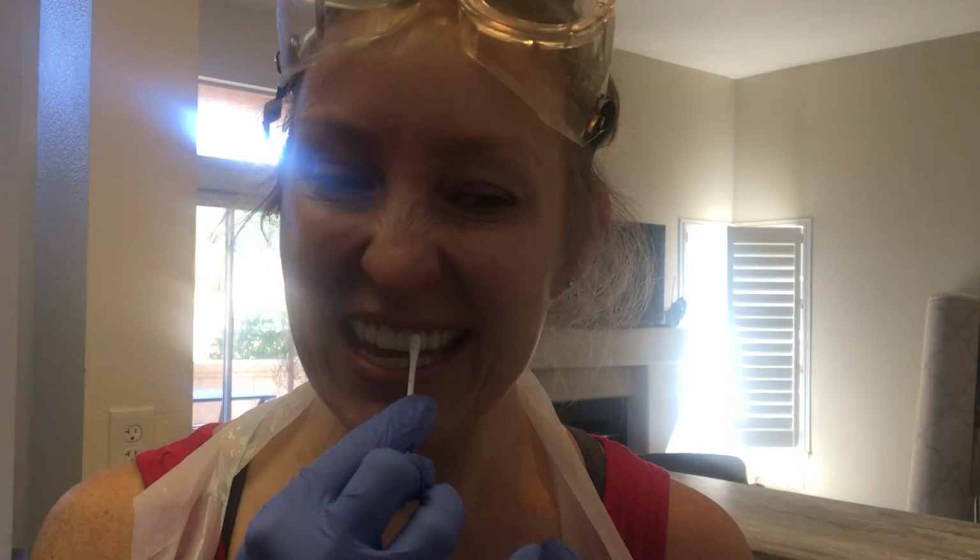So that leads me to this part. What I'm going to do for you is take my swabs. The first thing I'm going to do is swab my teeth. Now, maybe too much information for you, but I'm going to share it anyways. I ate eggs and I drank coffee and I haven't brushed my teeth yet after those things because I've had such a hard time with my microscope. I really want to see the bacteria in my mouth. So just FYI. I'm going to swab my mouth, run it over a few different teeth, okay? And then I'm just going to really make sure I get everything.